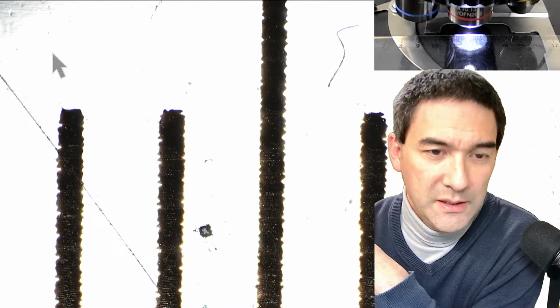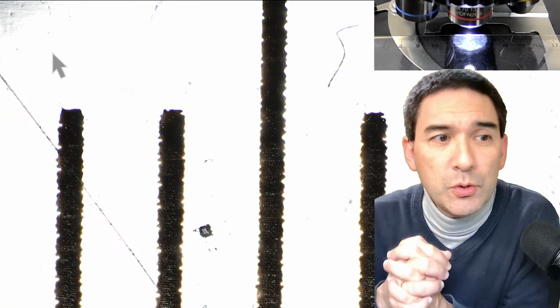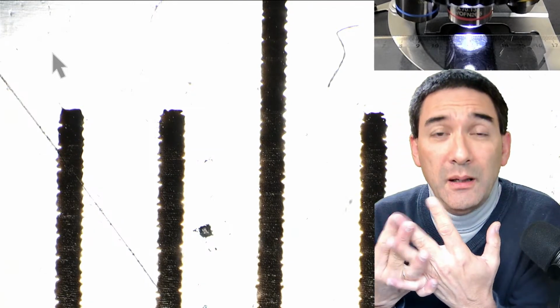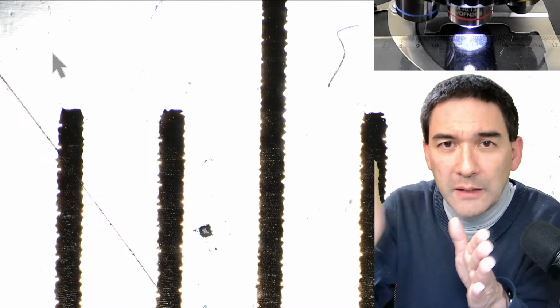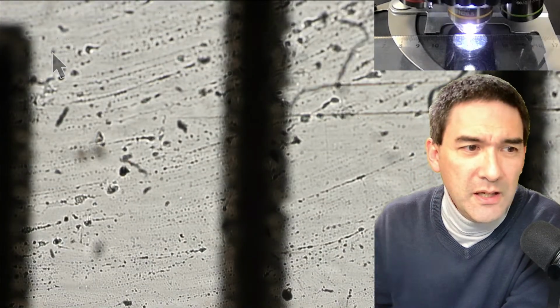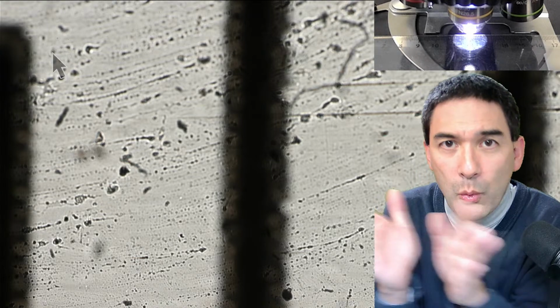And then what I've done is I've taken a picture of this, right? At the lowest magnification, at the 4 times objective. Why at the lowest one? Because you can then see the millimeters, right? If you go up too high with the magnification, you cannot see it from line to line. Maybe I can still do that. Yeah, barely. You see, I'm just able to get 3 lines, right? Because I also have a very wide field of view.